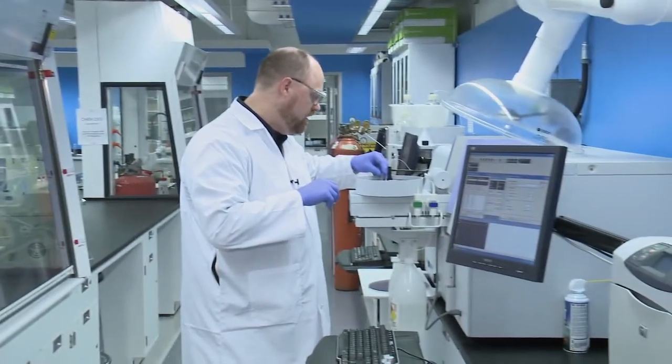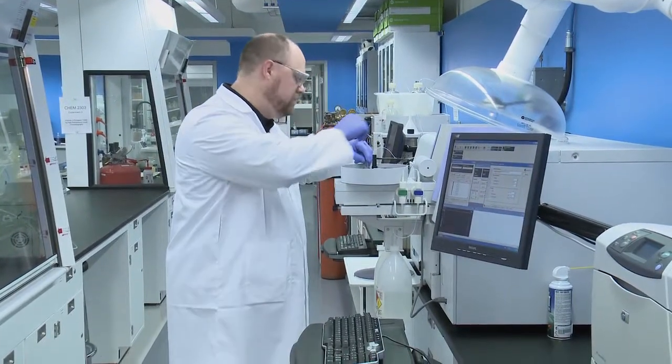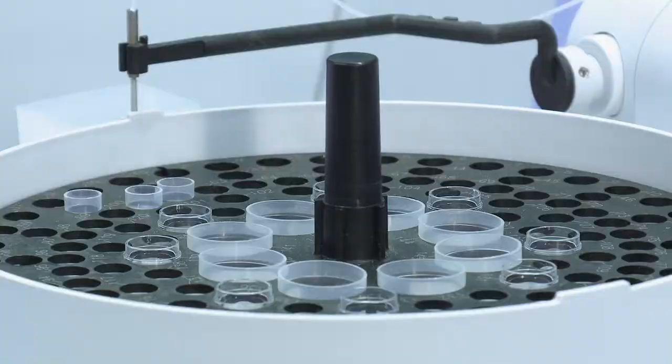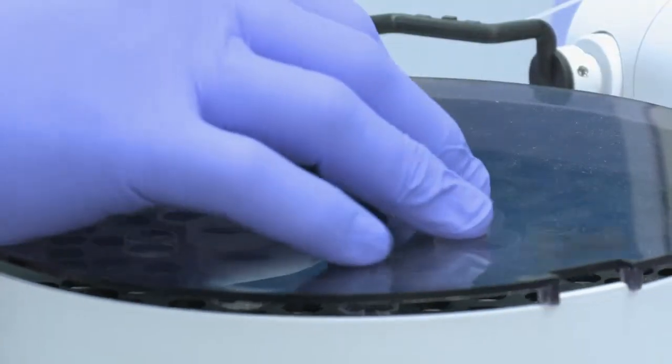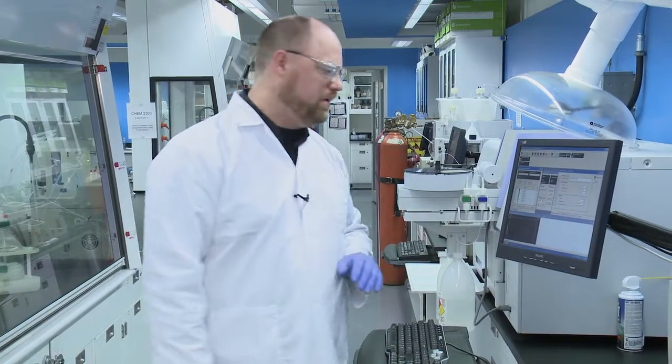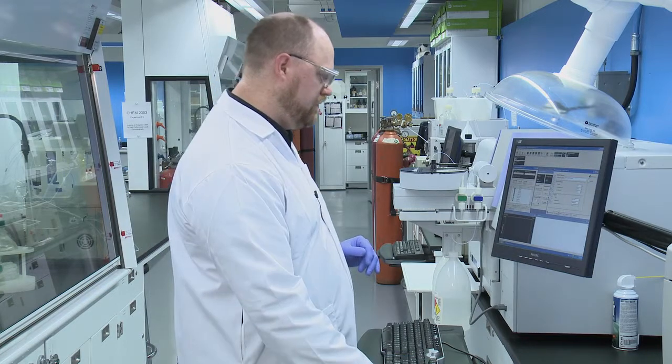Once you have all the samples loaded properly in the proper place, you can put the lid back on the auto sampler, make sure it locks into place properly. And then you're going to come to the computer and begin your analysis with the computer.